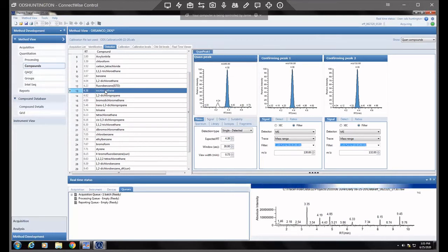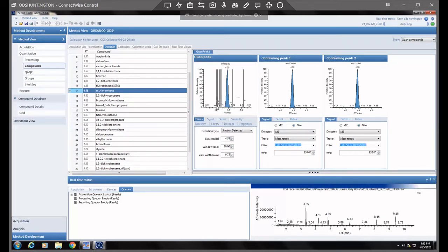If you end up seeing issues where your software starts to identify one as the other, then you can definitely shorten that window to about 15 seconds or something. It'll at least help narrow down, okay, from here to here is where we're looking, not from here to here. So it's just good when they're really close together.